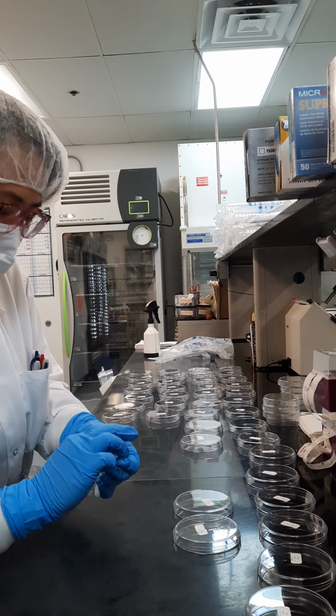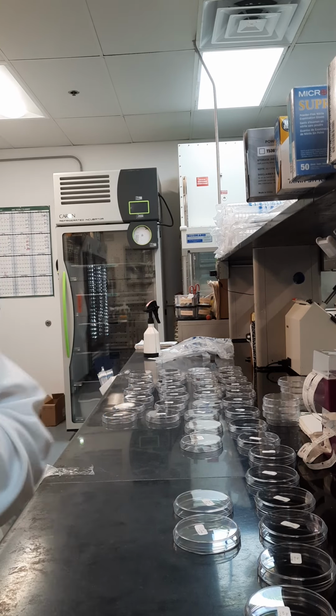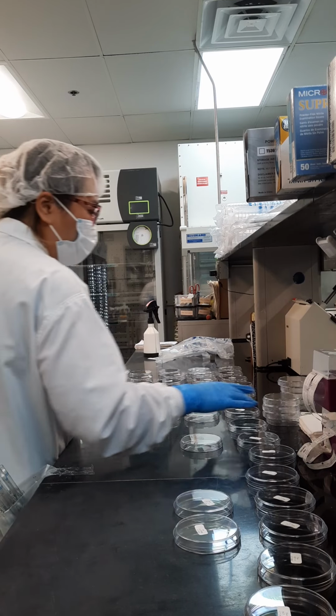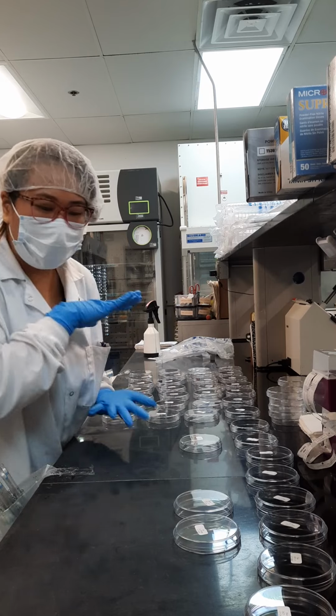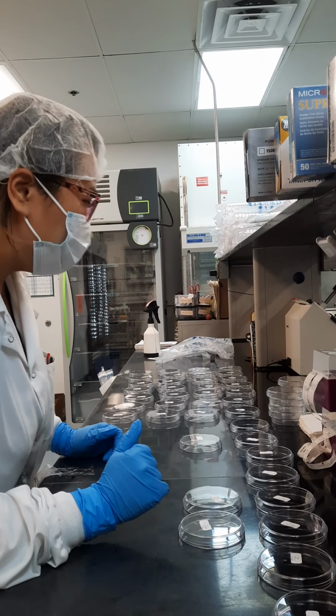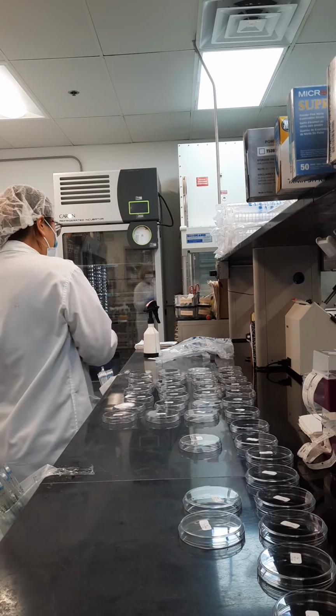So with a line of these tests, we usually do a control also. One control plate to make sure that it's actually sterile with no products in it. And then we stack it up. And our stacking will go as far as a stack of 10. These are my pipettes.